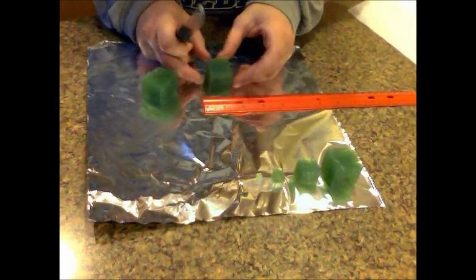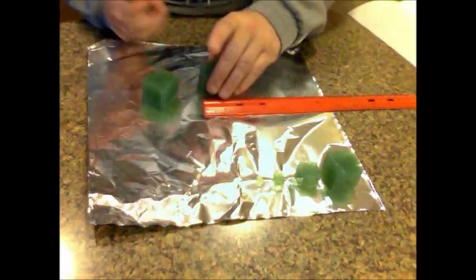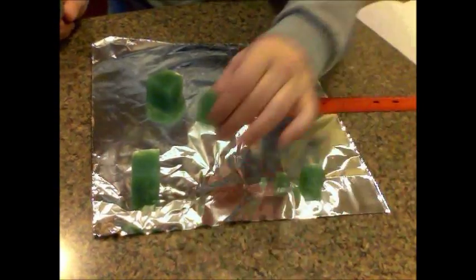That's pretty good. This one is a little narrow, but it'll work. There's your first block — should look just like this one.